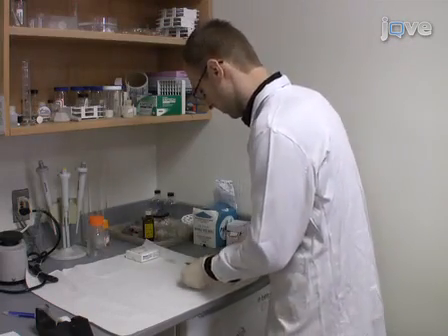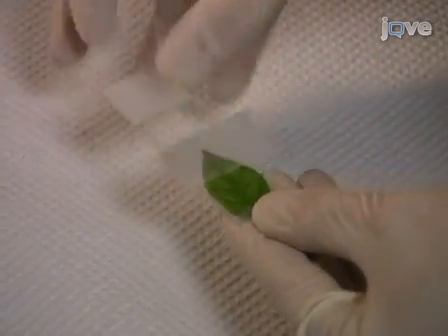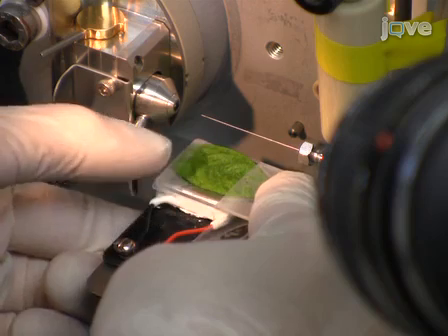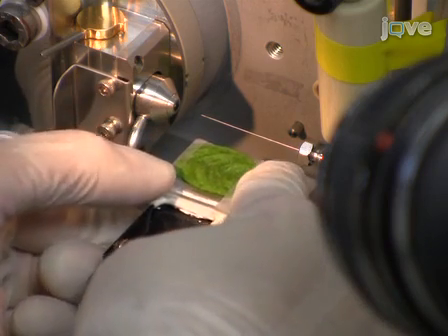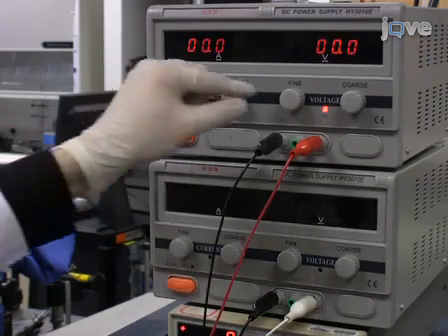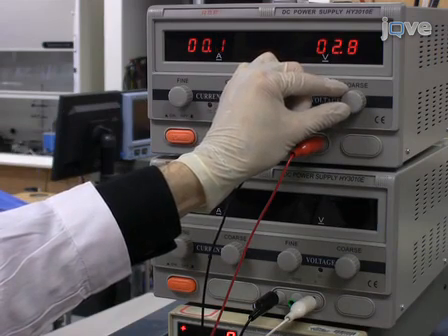Mount tissue sections of interest directly onto a flat surface, such as a chemically pre-cleaned glass slide without chemical modifiers. Secure the sample to a Peltier cooling stage immediately upon mounting. If needed, use a heat sink equipped with a low-power fan to facilitate heat removal from the Peltier stage.